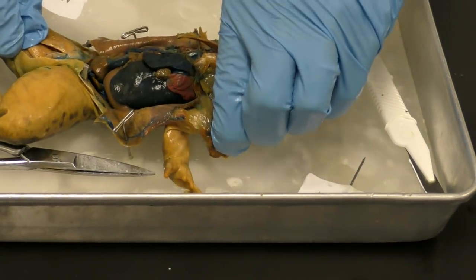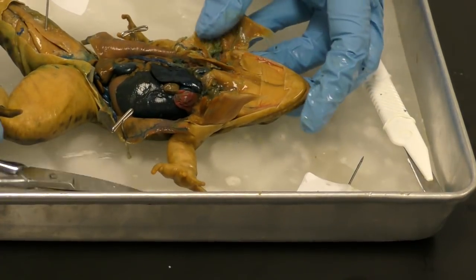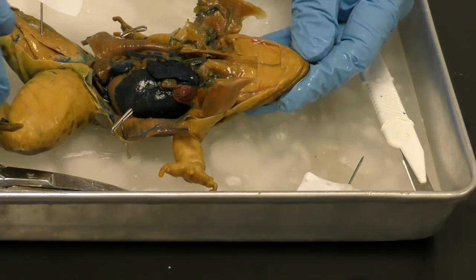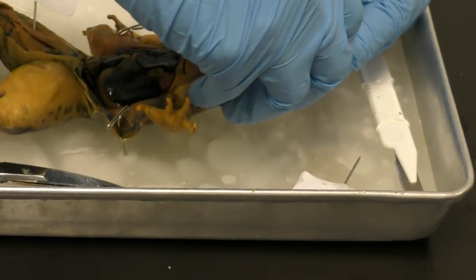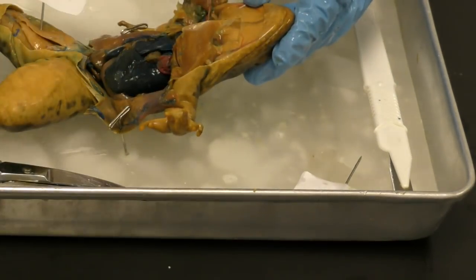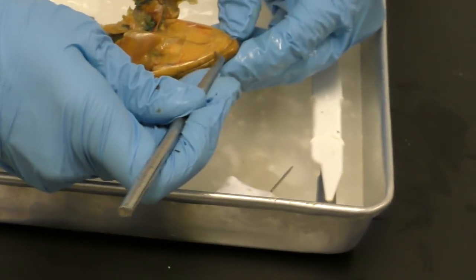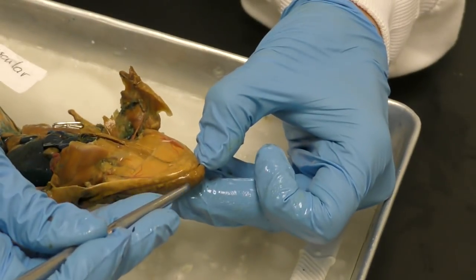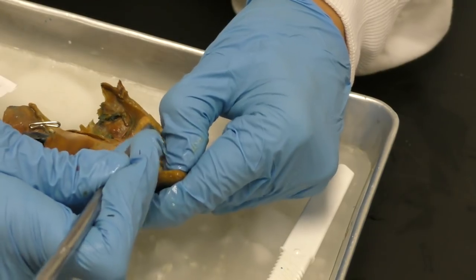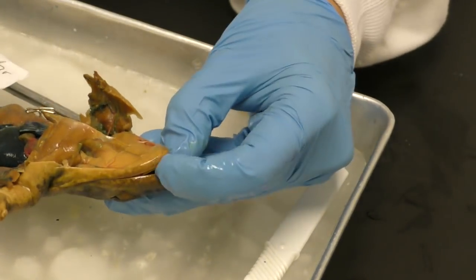And I'm gonna start going through one that we can actually start to see on the outside of the body. So if I start with the mouth, let's see if you guys can see that. Okay, so the mouth is the first part of this system that I'm getting at, and I'm trying to open it up so that you can look in there.